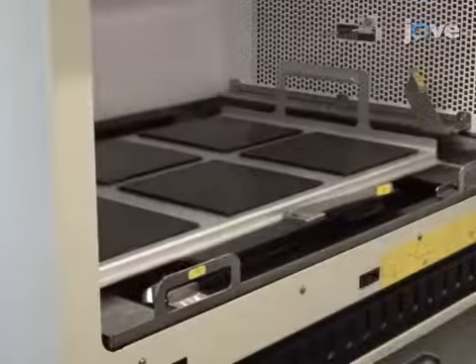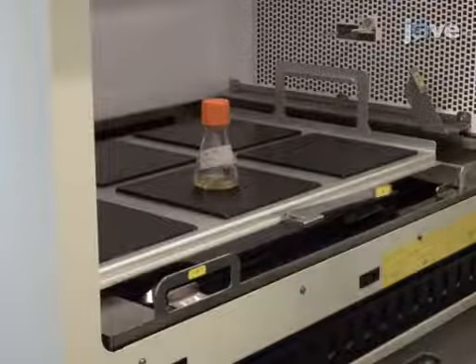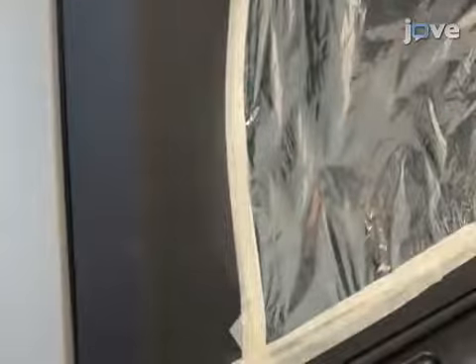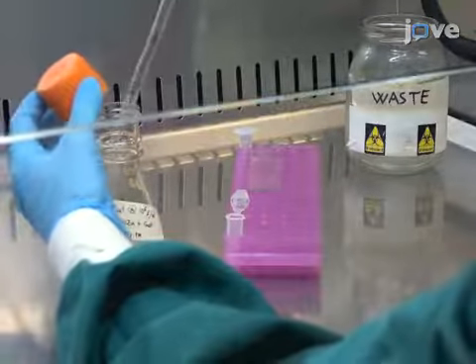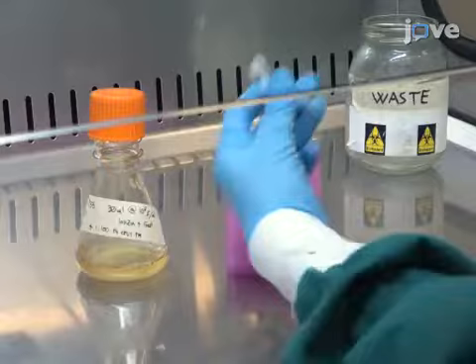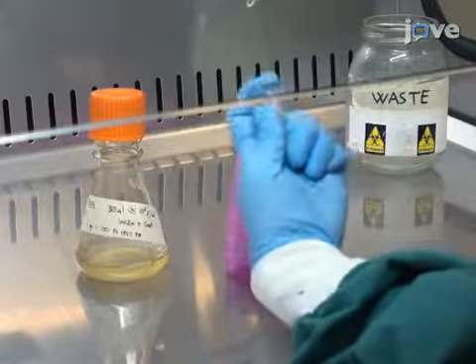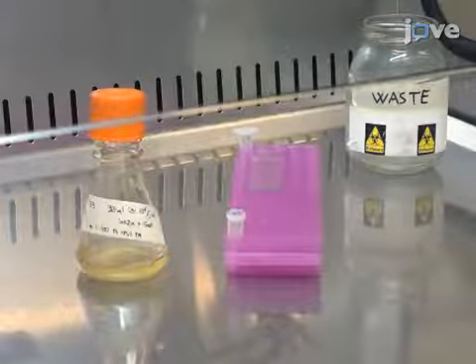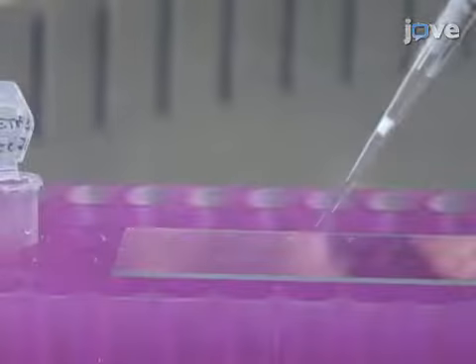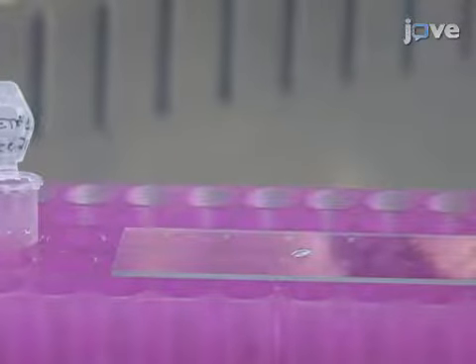First, incubate 30 milliliters of SF9 cells overexpressing the cypovirus polyhedrin protein for 3 days at 27 degrees Celsius on a rotating platform. Transfer 500 microliters of SF9 cell culture into a microcentrifuge tube using a sterile serological pipette, taking care to ensure that the sterility of the main culture is maintained by using a Class II biosafety cabinet and following standard aseptic techniques. Pipette 5 microliters of cells from the microcentrifuge tube onto a glass slide.